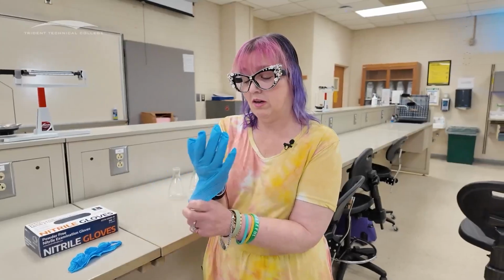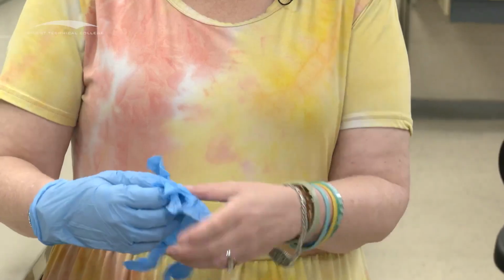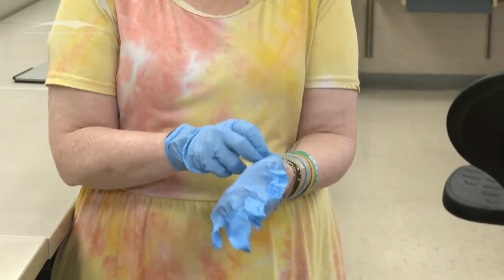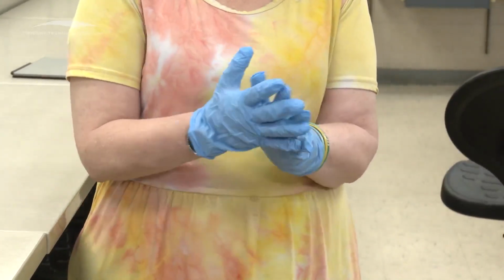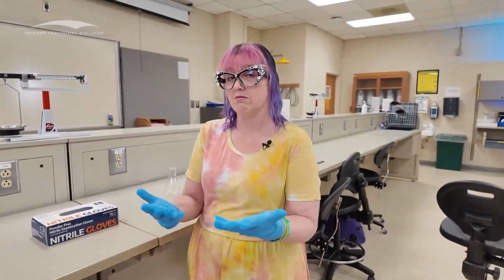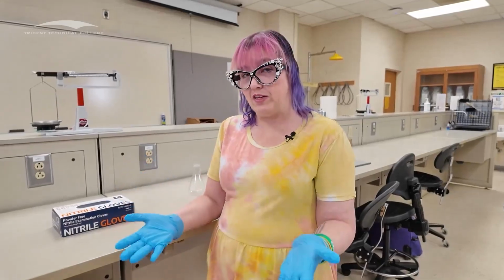So that's one. I want to get that over my watch because I want to make sure I don't kill my watch while I'm wearing it. And then I have my second one, if I can get this thing sorted out because they're all shoved in there. Not necessarily easy to put on. Some people take their rings off before they do this. It depends on how big your rings are. I have ones that are tiny so I don't break through my gloves. That was a decision we made. But these are how I put them on. Putting them on is the easy part. Okay? Taking them off is not the easy part.